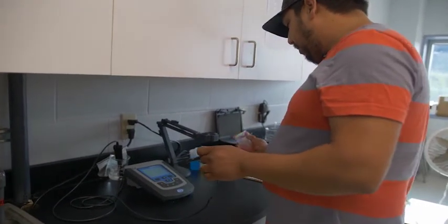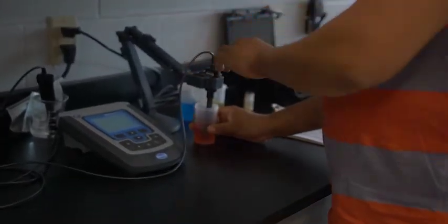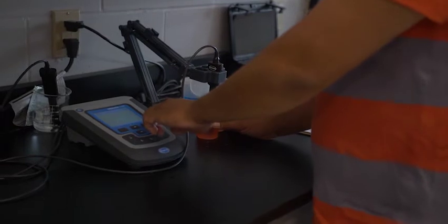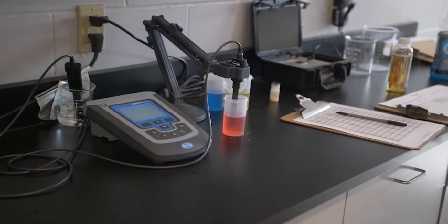And this is our pH meter right now that I'm calibrating. We do this on a daily basis just to ensure that it's giving us proper pH readings.